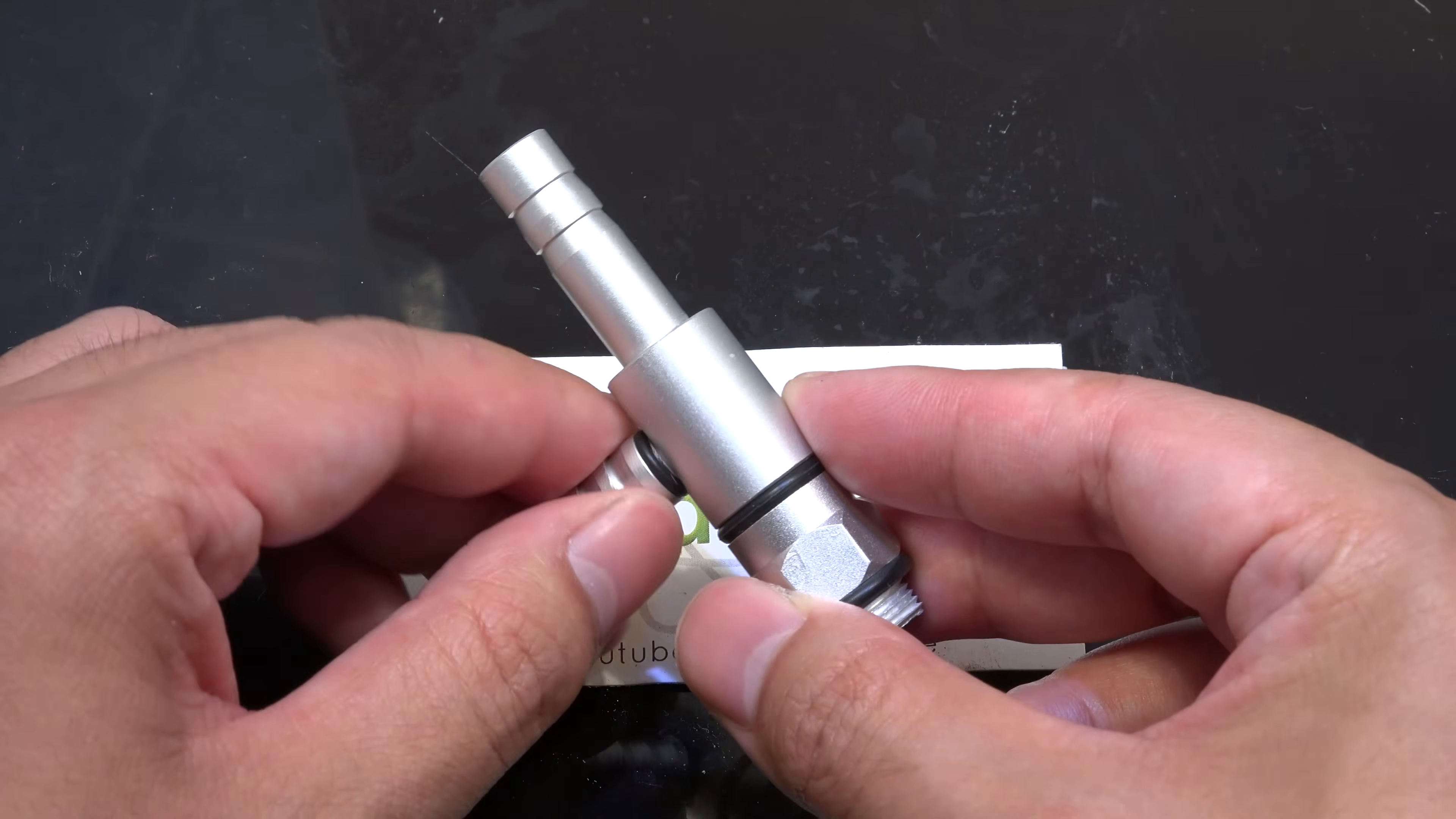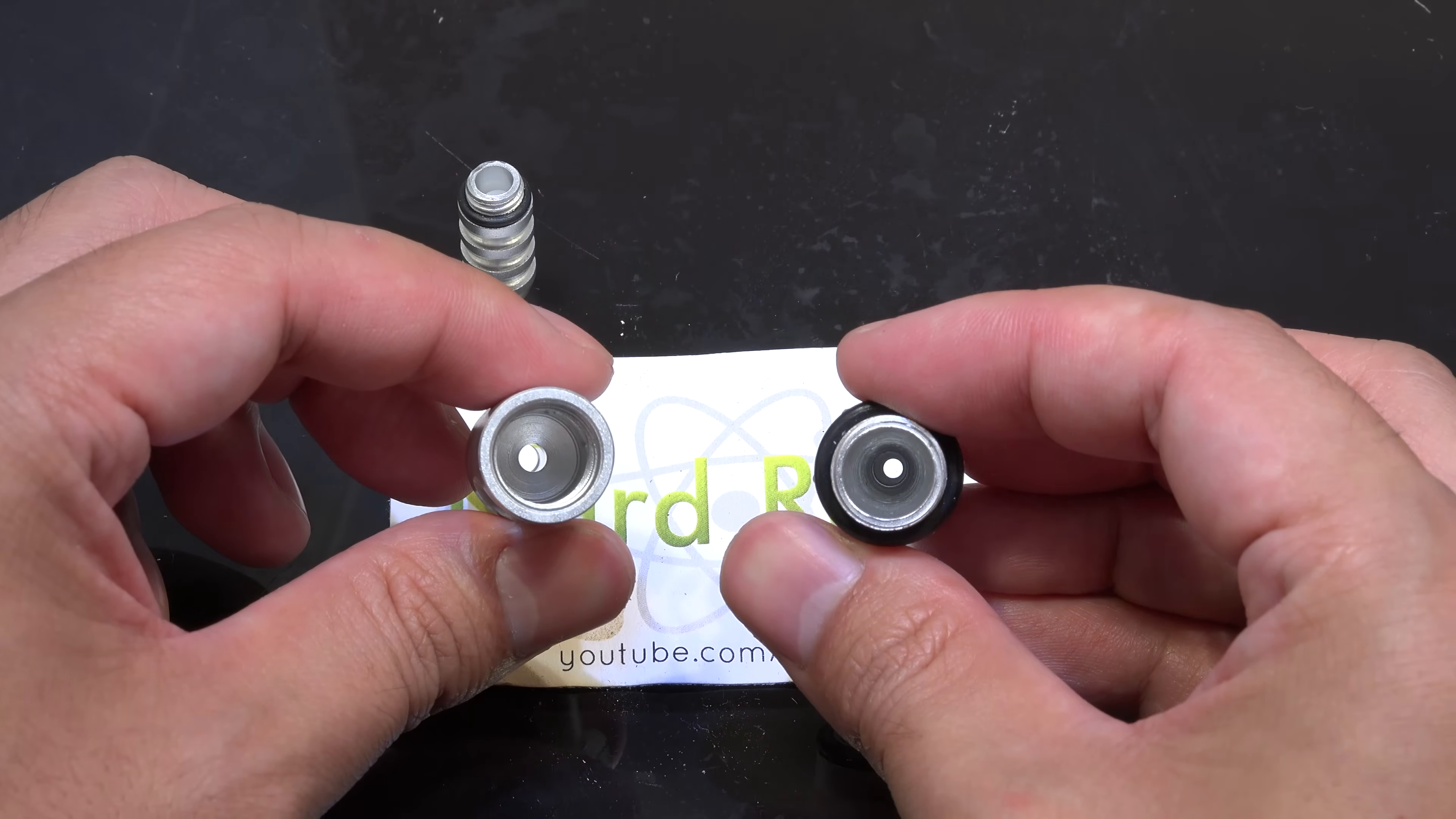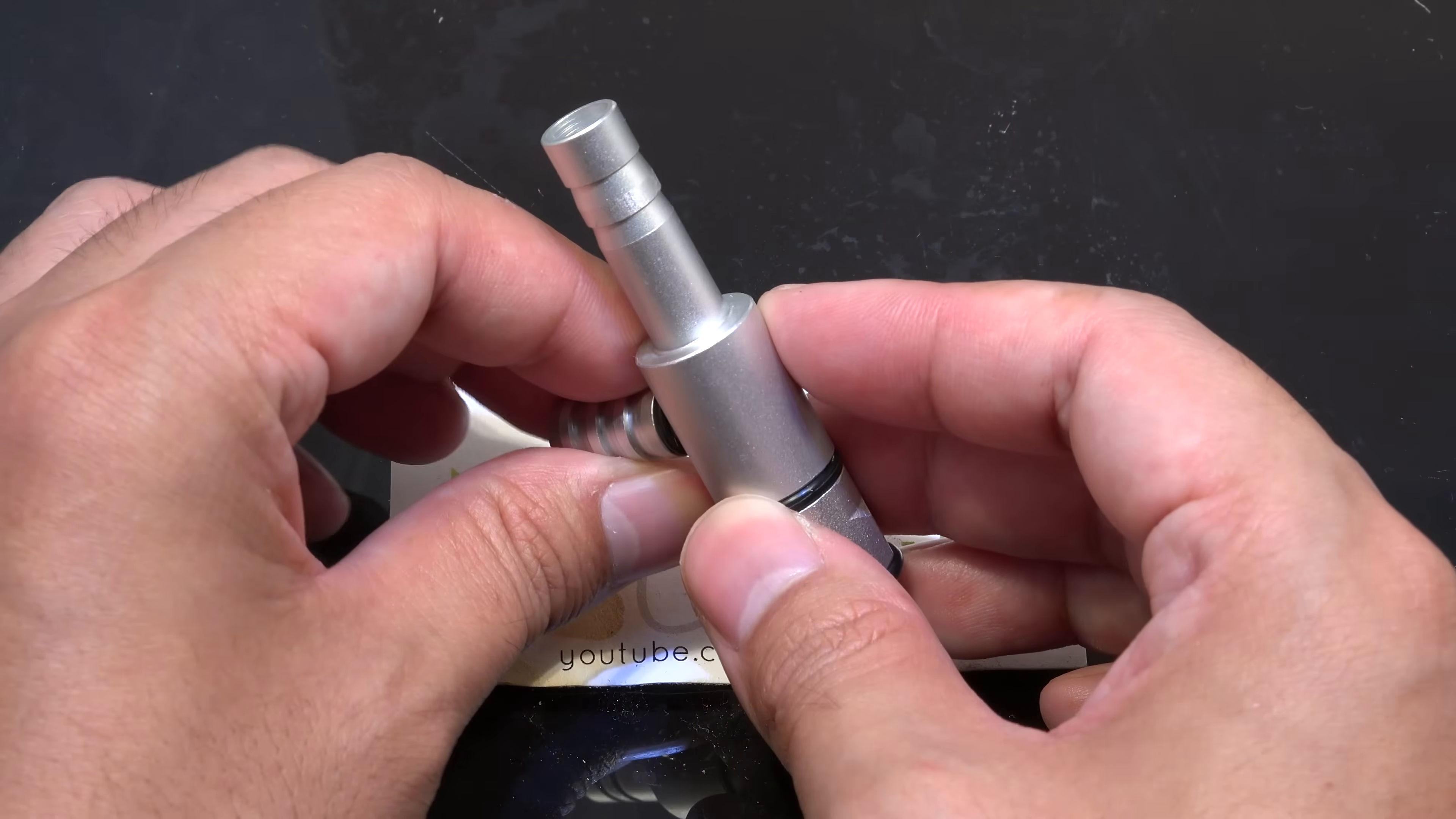So let's open it up. This is the vacuum port. There is a one-way check valve inside this connector to prevent backflow, but I'll be honest it doesn't work very well. This is where the vacuum is actually generated, it's just a nozzle inside a tube, that's all it is. First you send high pressure water through the inlet here on the right where it reaches this nozzle and becomes a high speed jet at lower pressure. The jet shoots down this tube and thanks to the venturi effect it pulls any gases with it and creates a vacuum. You access the vacuum through this port on the side.